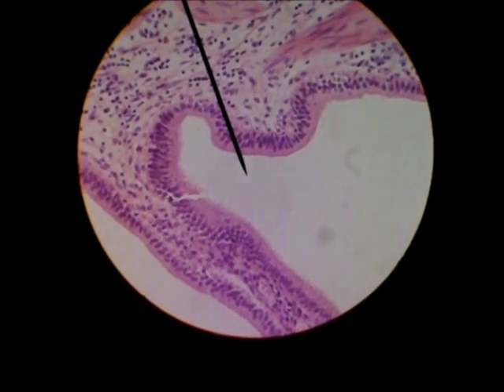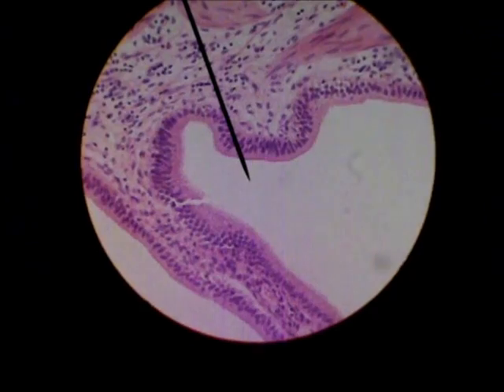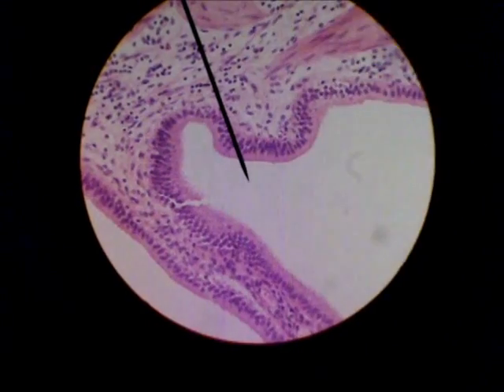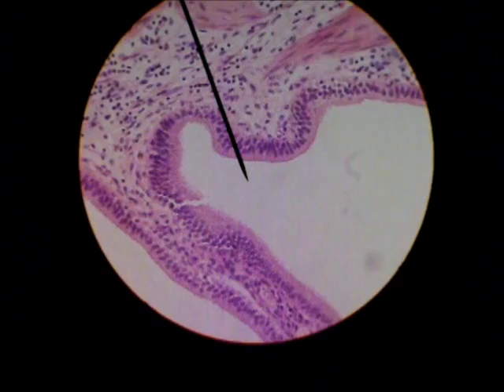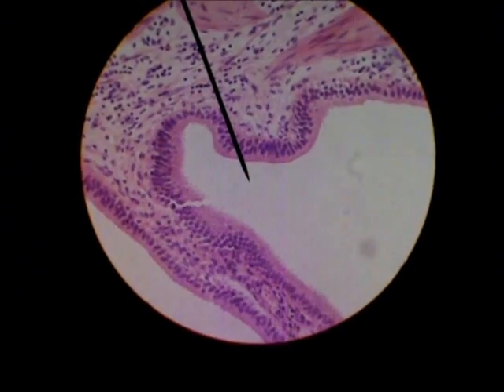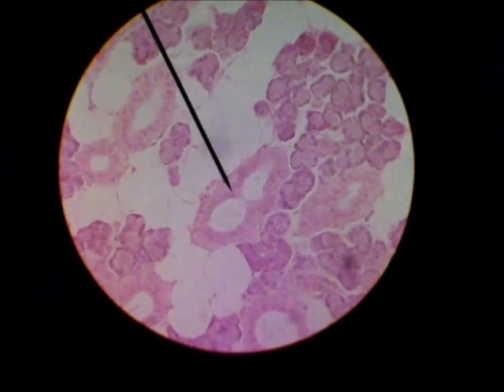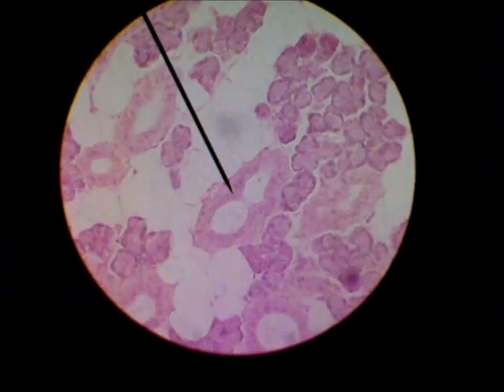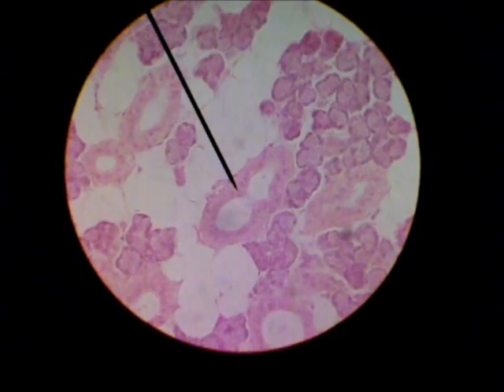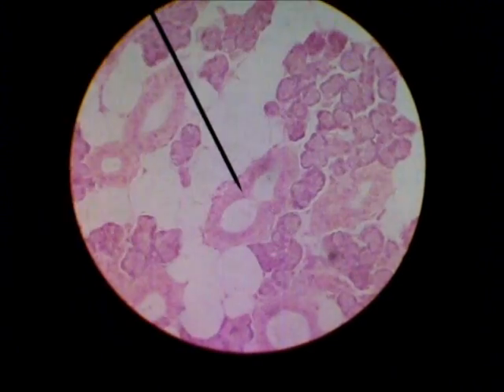This is simple columnar epithelial tissue. Simple columnar epithelial tissue. Stratified columnar epithelium tissue. Stratified columnar epithelial tissue.